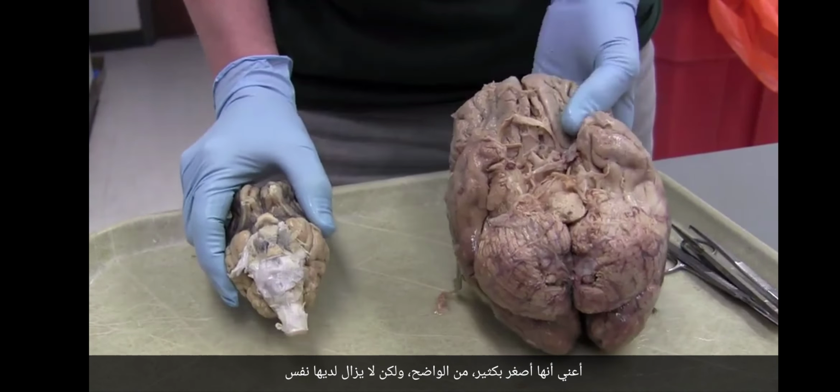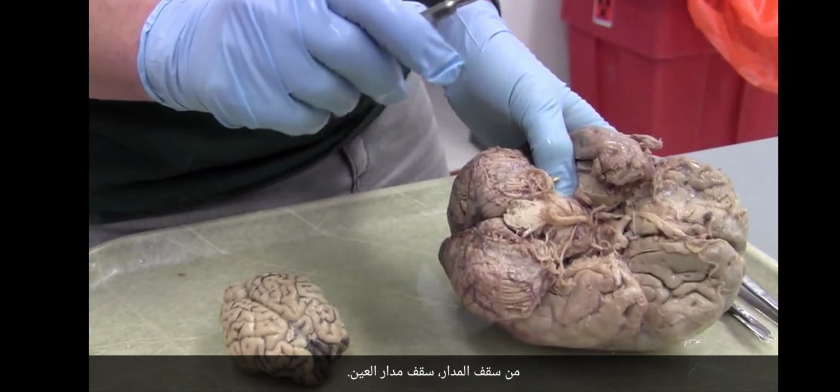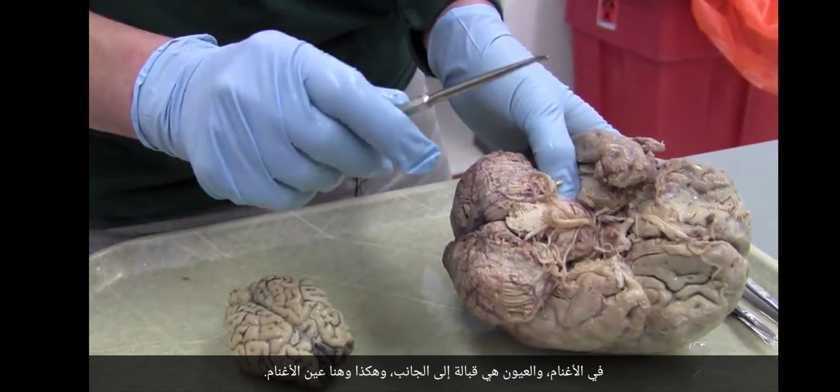Okay, so in the sheep brain, let's get this to a place where we can start to understand what we're looking at. Well, we already know a few things. This is spinal cord. Here's hindbrain. This is the cerebellum, and we're going to look at a little bit more about the cerebellum in a bit. Here's the telencephalon. You remember that in the human brain, we have these indentations. These indentations are formed by the roof of the orbit of the eye.